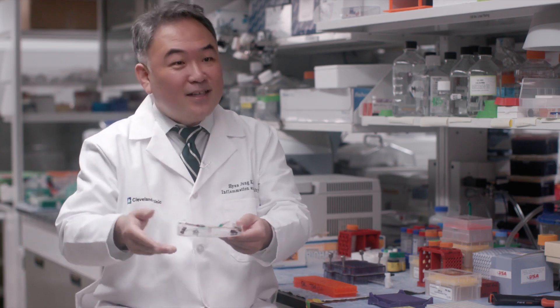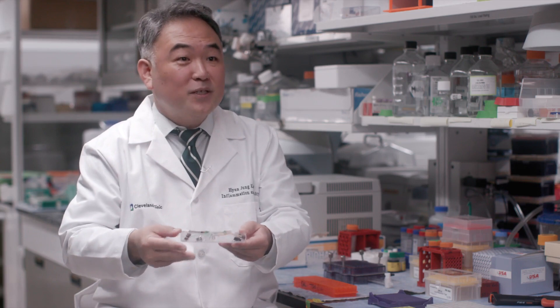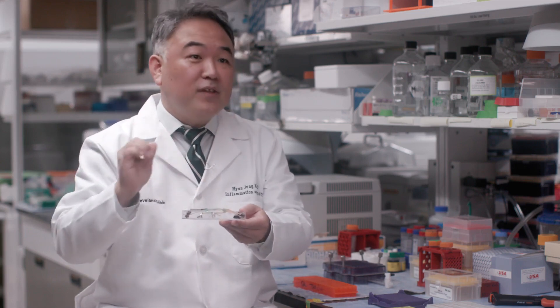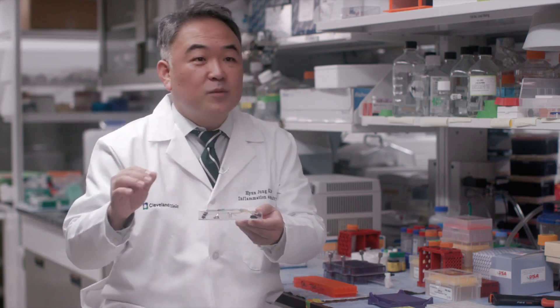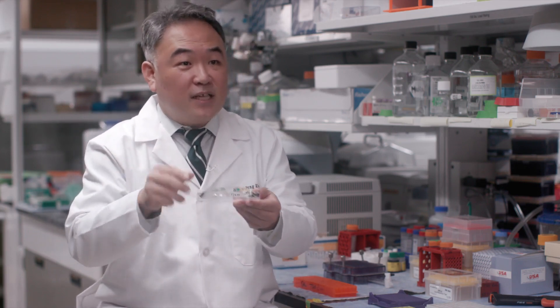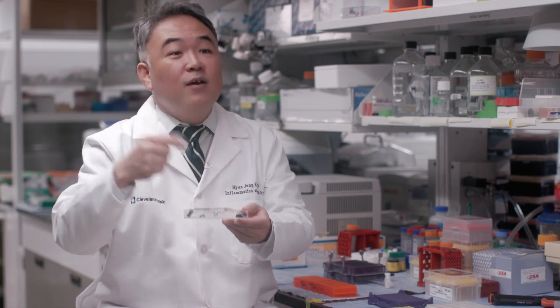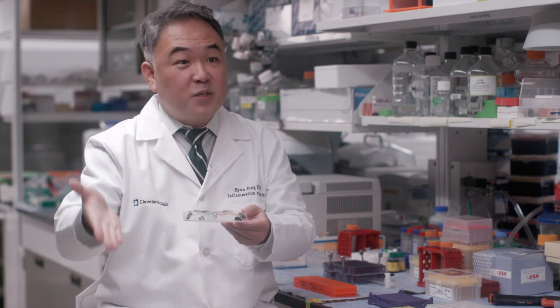This device is our playground. We put different types of cells from different patients, and then each individual chip reflects a specific patient — we call this the patient-specific chip.